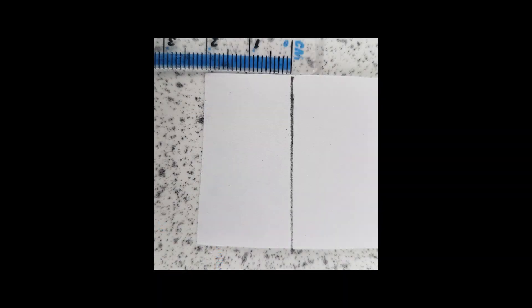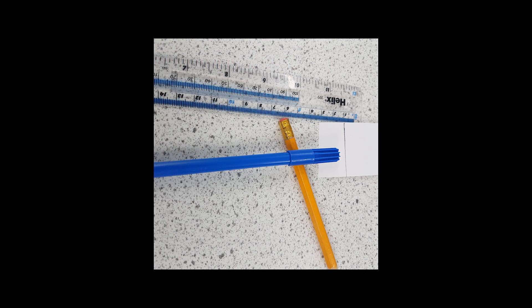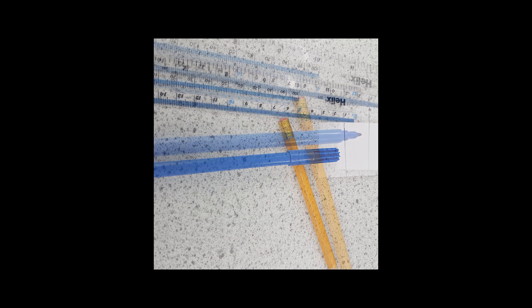So the first step is to get a ruler and measure off, we're using a pencil, a two centimeter line. So put a dot there and then you're going to draw a straight line. Once you've drawn that line, you're going to take a blue felt tip and you're going to place a dot on the chromatography paper.